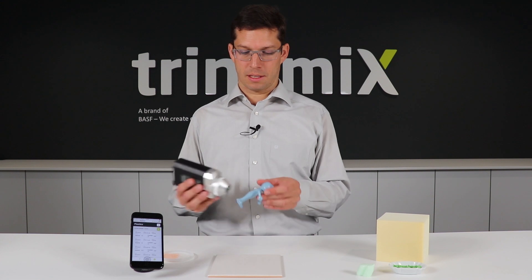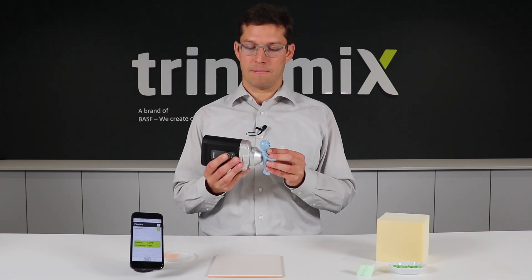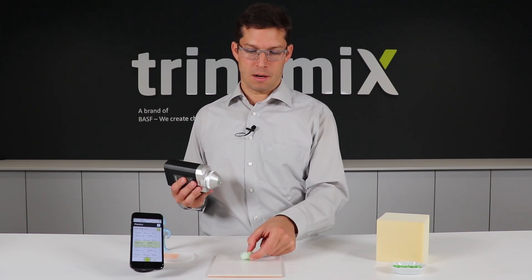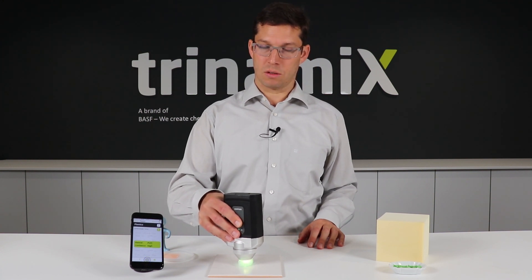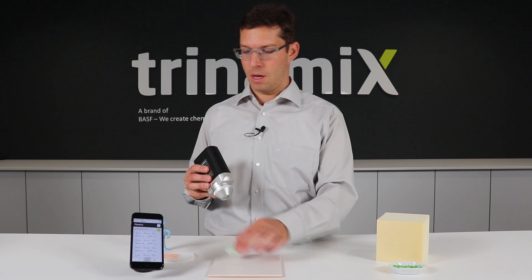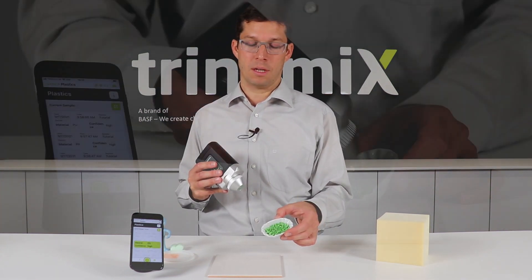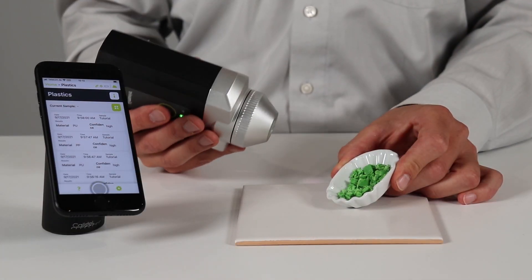There's a very flexible way of testing the samples. You can hold them like that, or you can put them on a ceramic tile to perform a measurement. And in case you have granules or flakes, just put them in a ceramic bowl. It's very easy to use them.